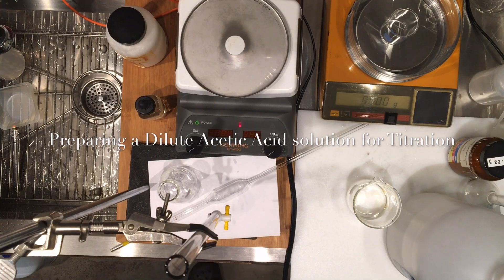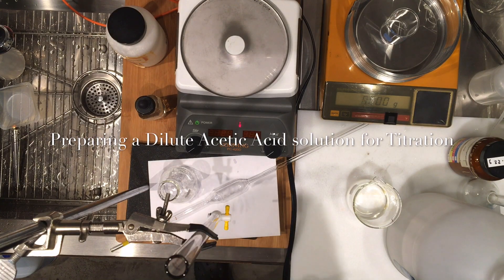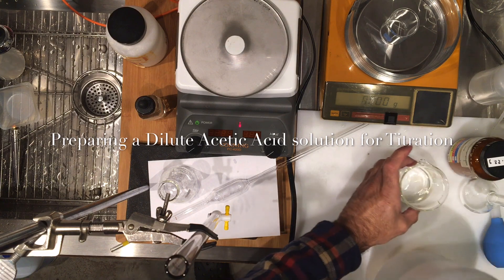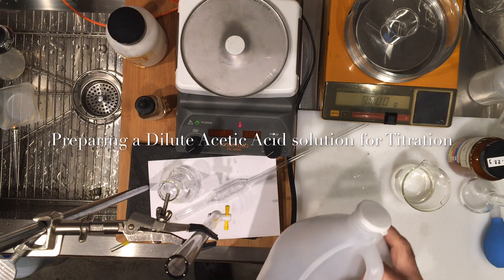In this video, I'm going to show you the process of titration for determination of concentration of white distilled vinegar.